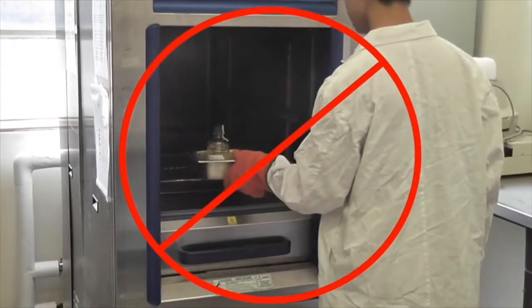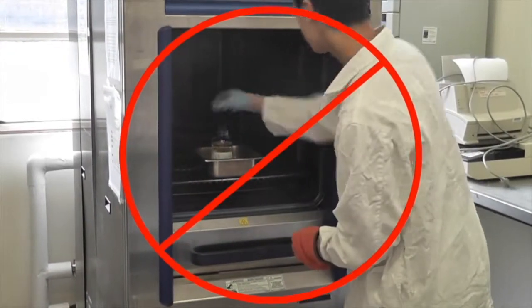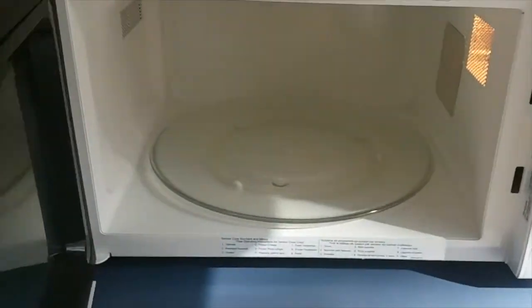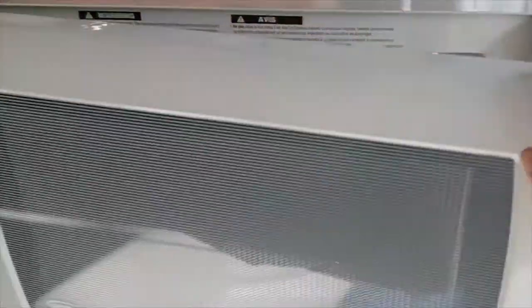For similar reasons, do not re-autoclave media if it solidifies. Simply use a microwave or other heating device to liquefy the media and pour it before it solidifies.